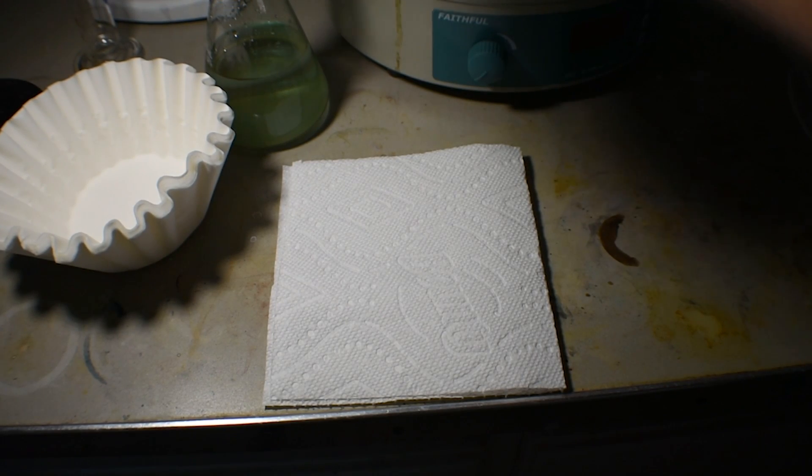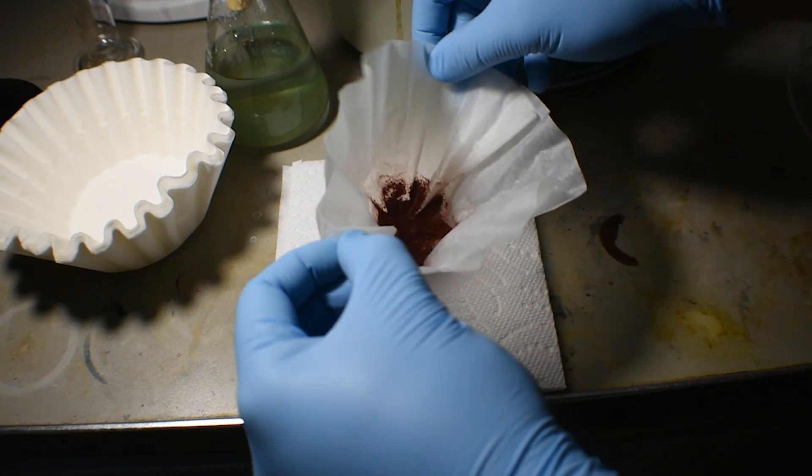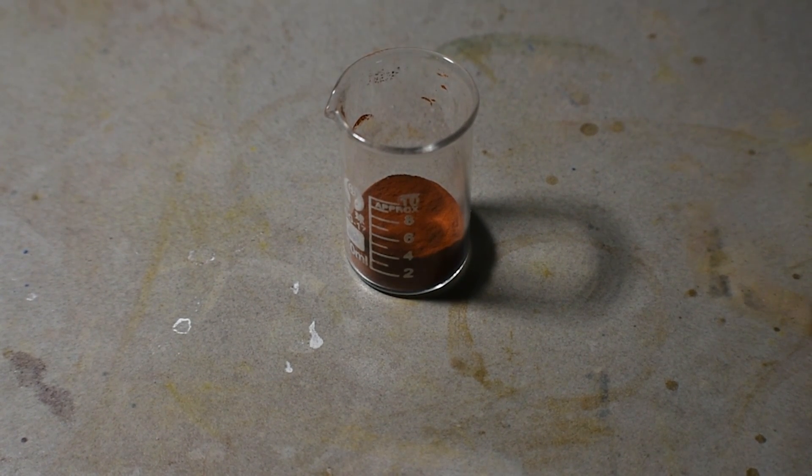Once washing was completed, the solid product was allowed to dry at room temperature overnight, which then resulted in a fine red-brown powder.